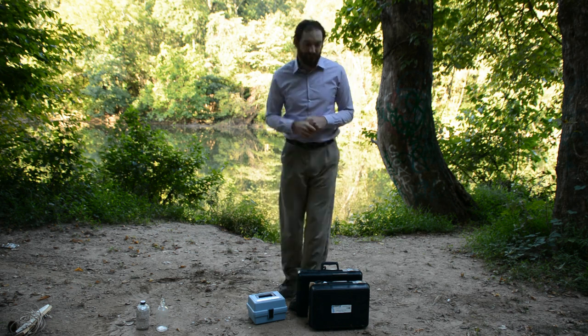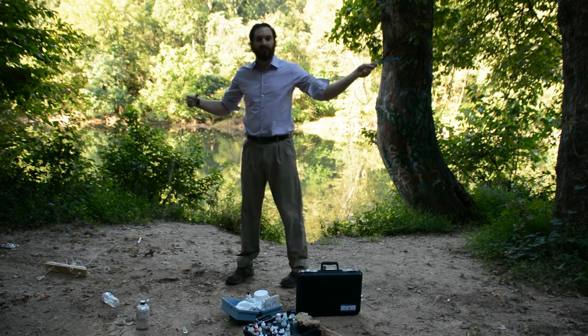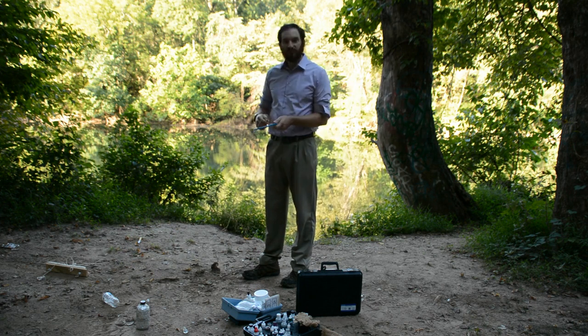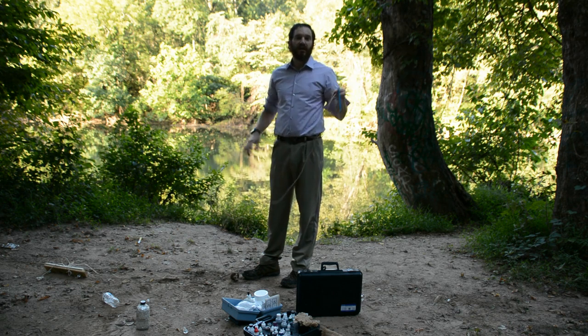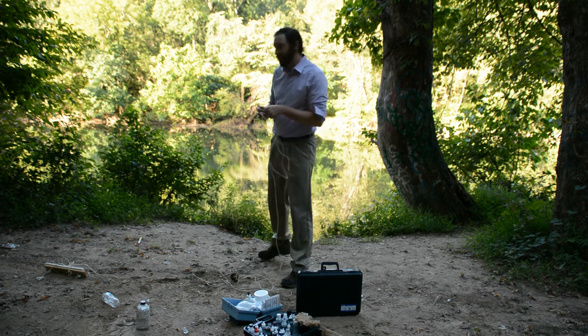Alright, so the first thing I'm going to do, I've got my thermometer here, I attached it to a rope. I'm going to toss it out into the water a little bit. I know it's not the cleanest looking apparatus, but it will allow us to sit and collect the temperature. So I'm going to toss this out, let that sit, and then while that's collecting the temperature, I'm going to go reach down and grab a small little water sample so that I can get the initial dissolved oxygen reading.